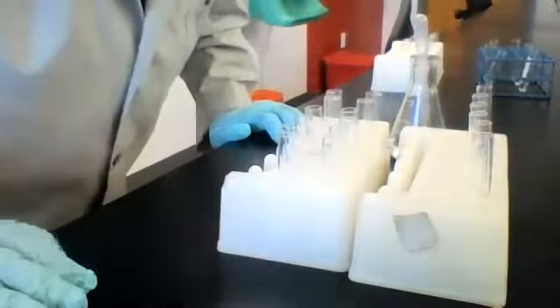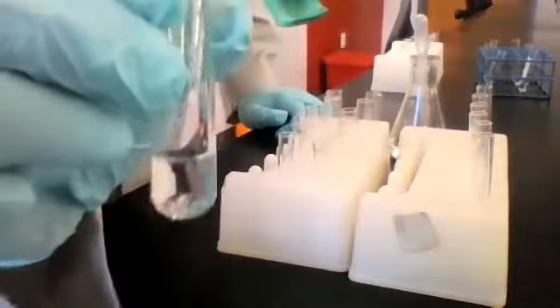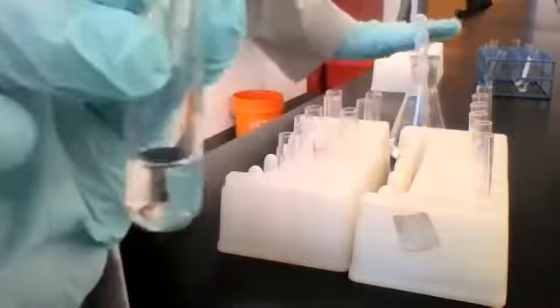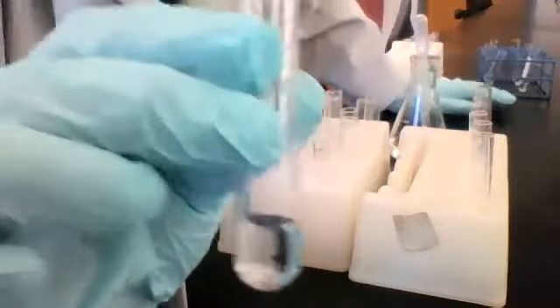All right, I hope we're good to move on. Our next test solution is water. Remember what we said about water? When you add it to a stable solution, it is just going to dilute that solution. It's just going to decrease the concentration of that solution.